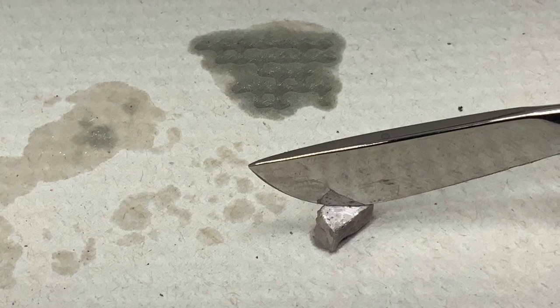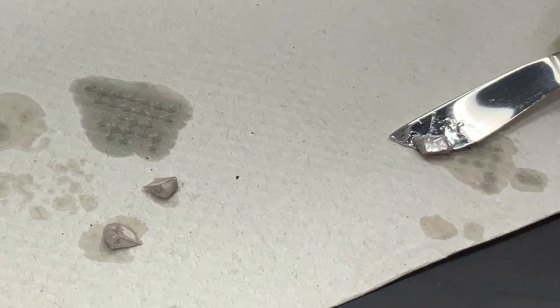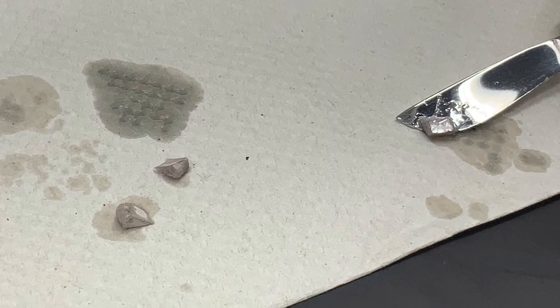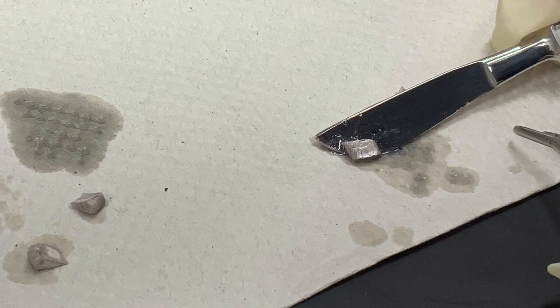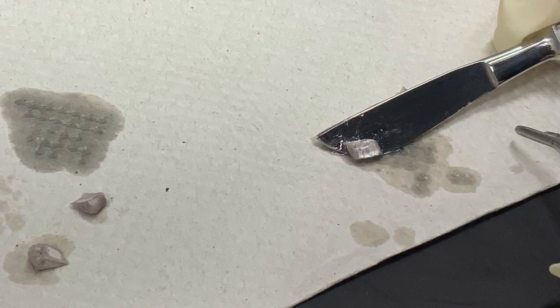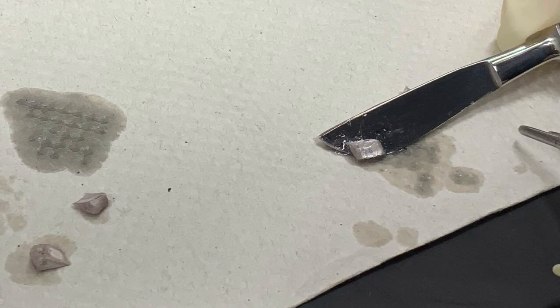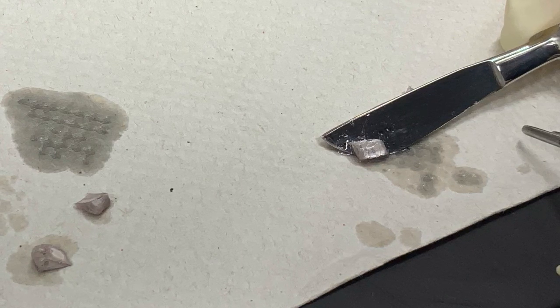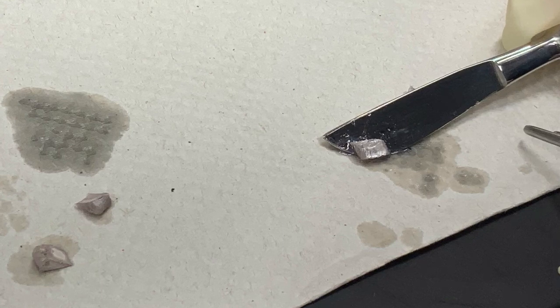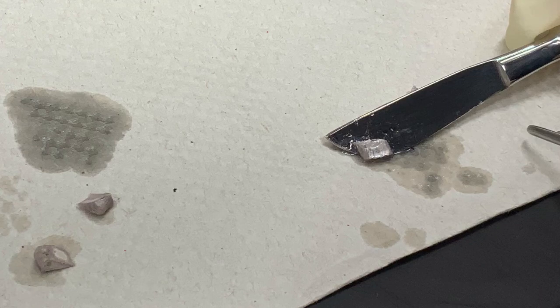This small piece of solid sodium is dull and gray because its surface has reacted with the environment, but we can easily cut through this piece with a scalpel knife and briefly expose the appearance of pure sodium, which is lustrous and silver-colored until it reacts with the environment. The chemicals in the environment that the pure sodium surface reacts with are oxygen and humidity, which is water vapor.